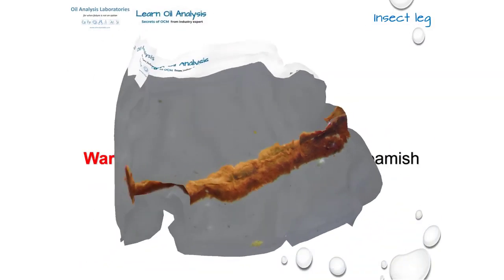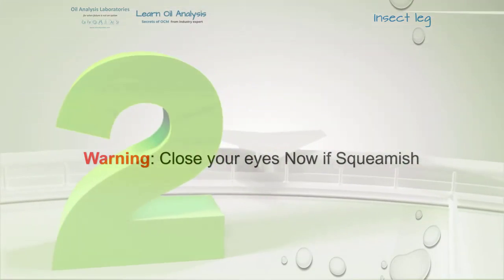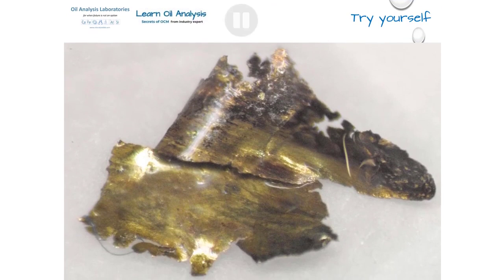As I know some people can be a little squeamish about this next picture, I will give you 3 seconds to close your eyes if you are. 1, 2, 3. As you can see, it's an insect leg, most likely an ant, although I'm sure an entomologist will end up writing in afterwards to tell me exactly what it is. This was found in a blocked breather on an outdoor storage tank in which an ant nest had decided to colonise. This final one is safe to open your eyes now, by the way.